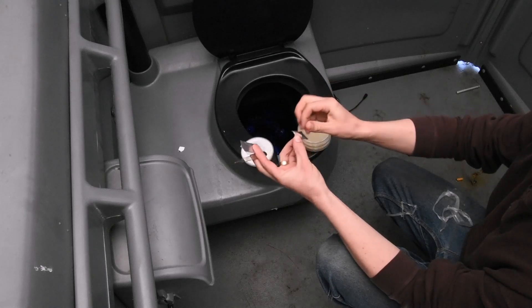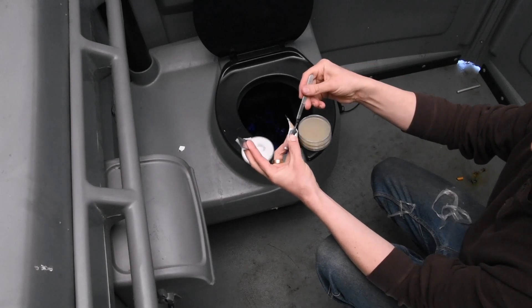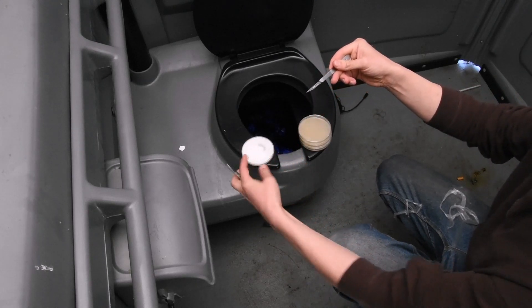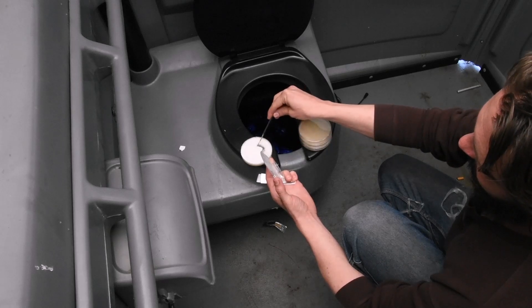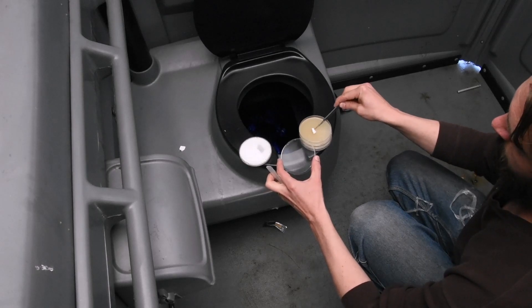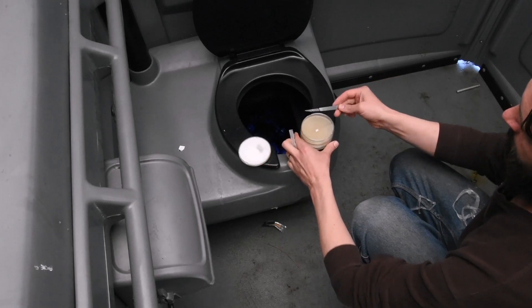It doesn't look like he brought alcohol to wash his hands. Is he doing this with dirty hands? He's putting the blade on with spare blades and parafilm in the same hand. He's preparing to open the culture. He's multitasking, folks. Oh dear — he forgot to tape this one down like he did last time. Let's hope this one works. He's transferring it to plate number one. Oh my gosh. Is this happening? He just made three transfers while only opening the mother plate one time.